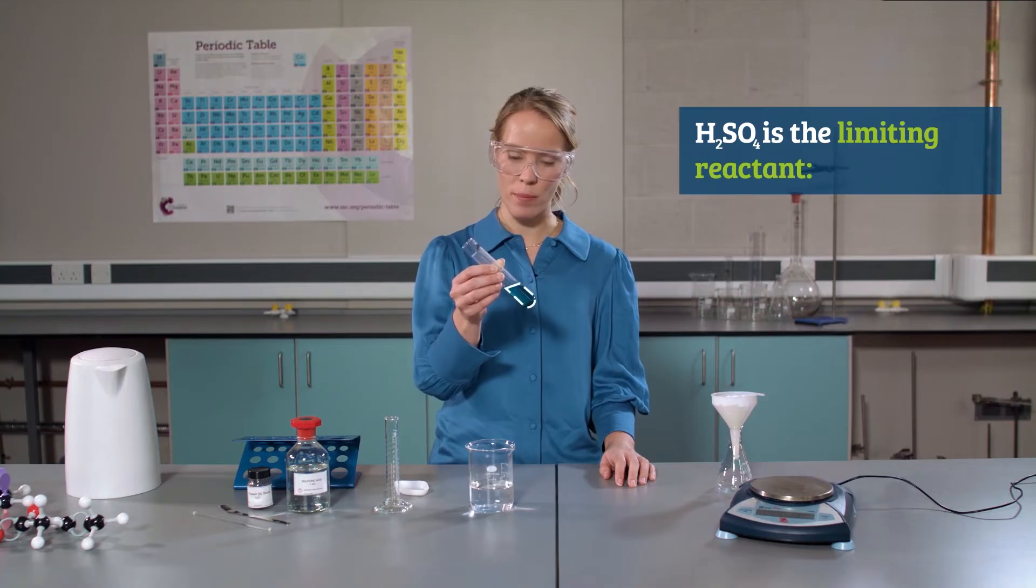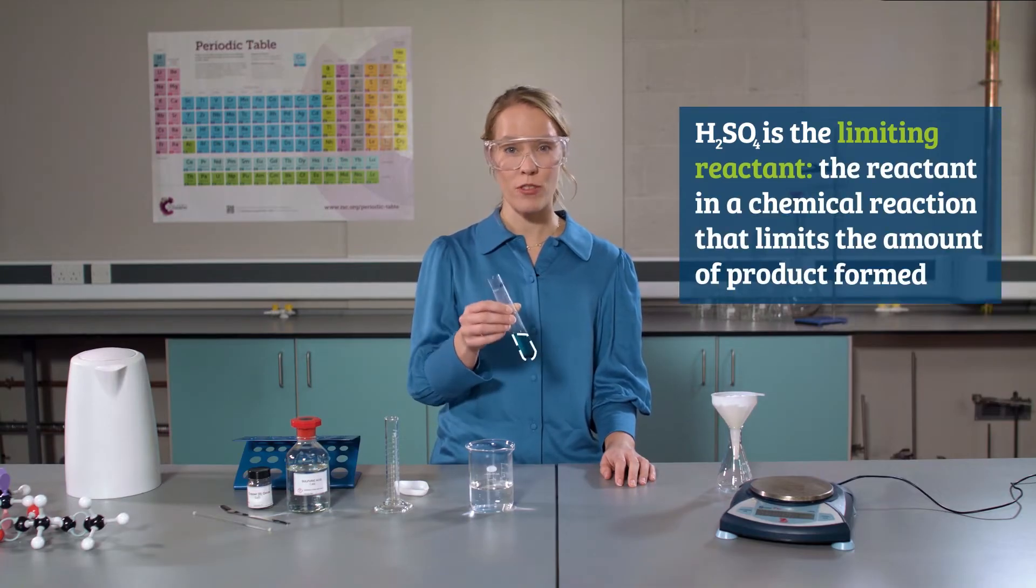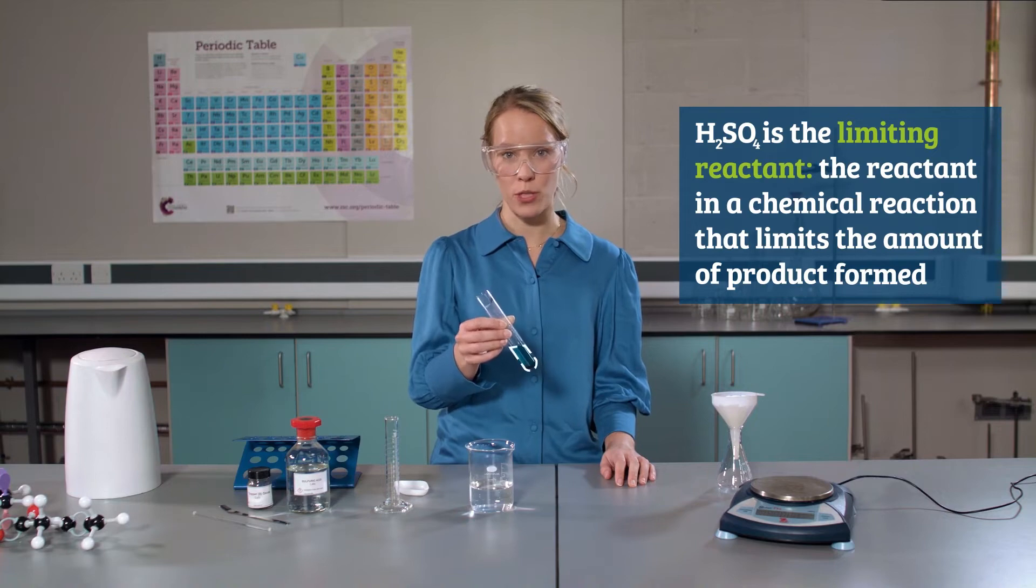We added an excess of copper oxide to ensure that the reaction has completed and that all of the acid has been neutralized.